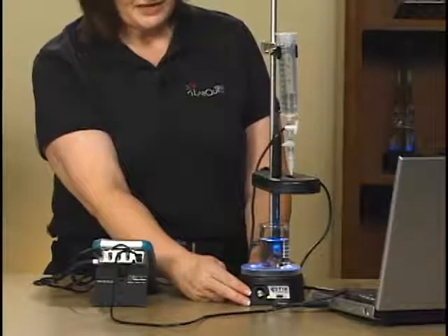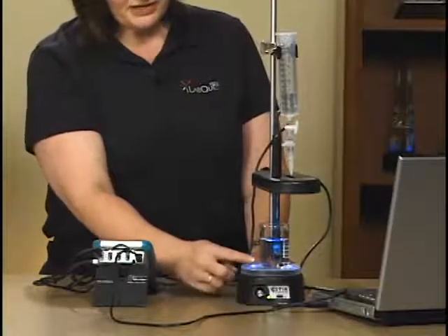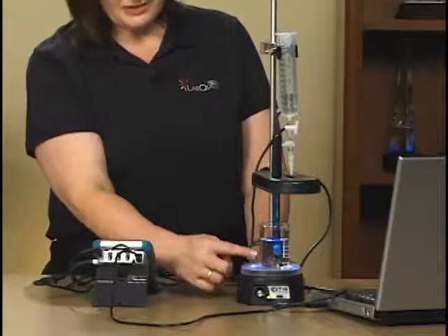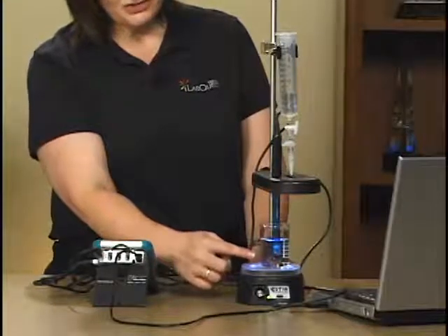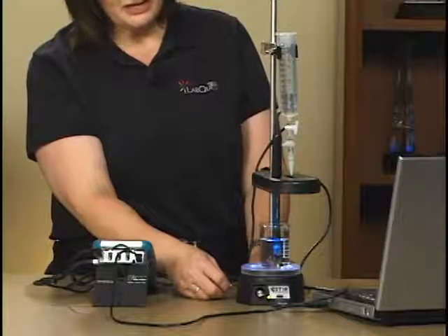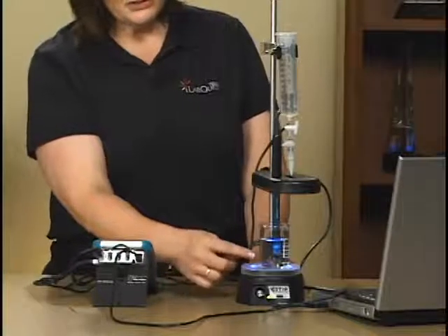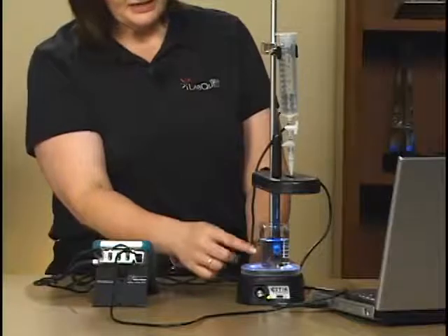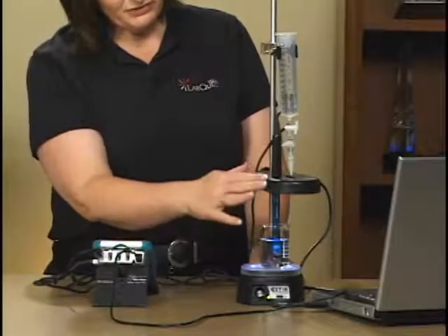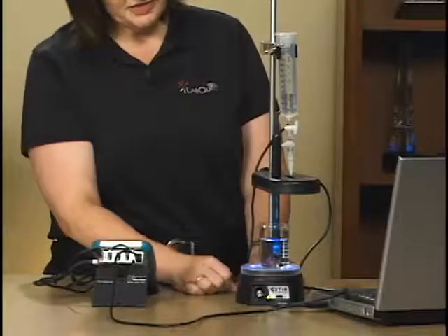The stir station today is powering a little micro stirrer, that's a paddle wheel essentially attached to the bottom of the pH sensor, keeping a good flow of the solution going past the glass bulb of the pH sensor. This blue pH sensor going through the drop counter is what's going to be taking the pH of our titration.